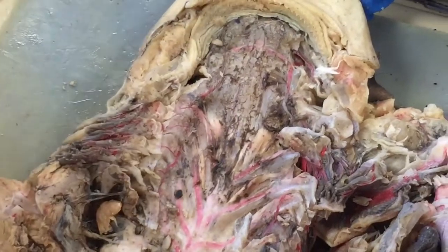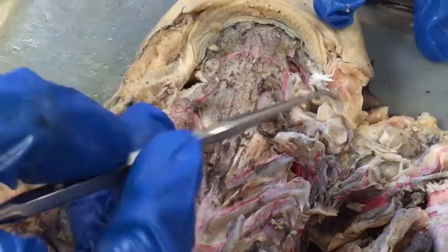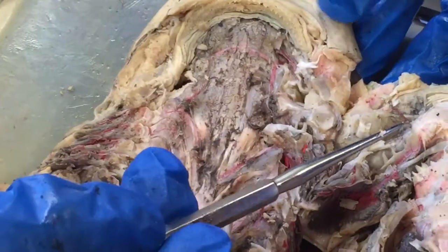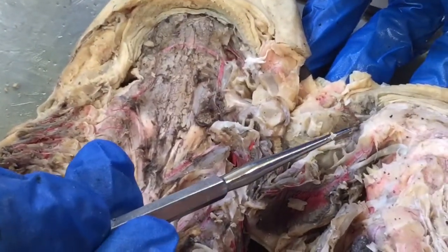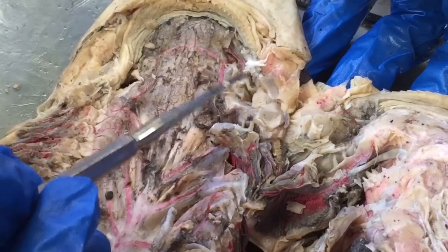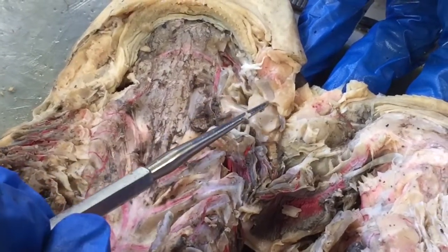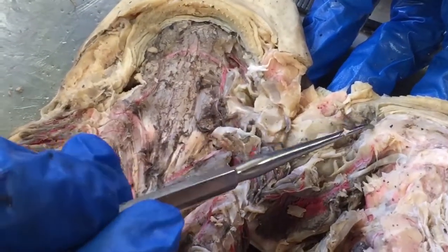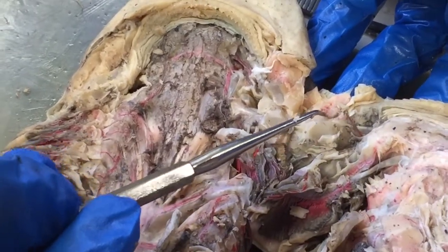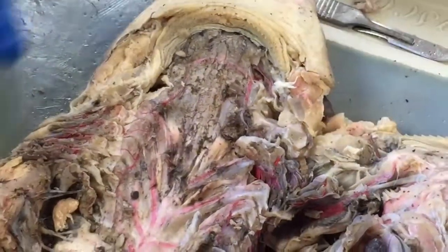That's all internal carotid. The corresponding external carotid basically runs from this side all the way over here, on the other side of the spiracle and going to the edge of the mouth. Those are the external carotid arteries.